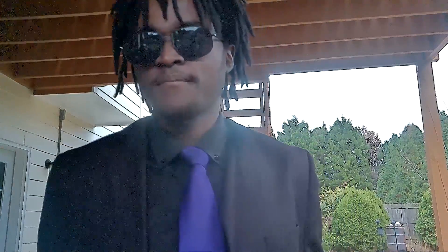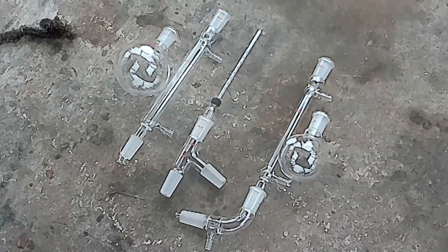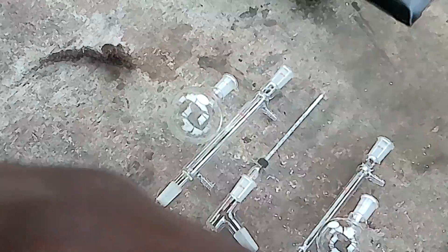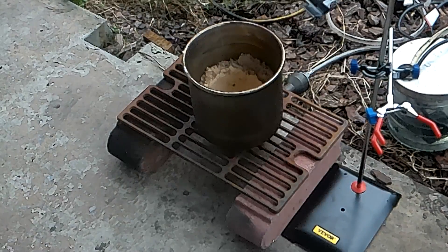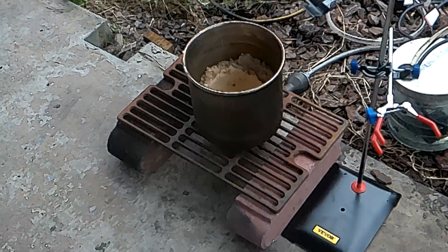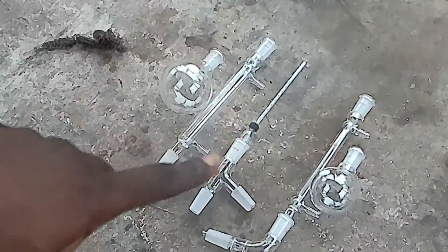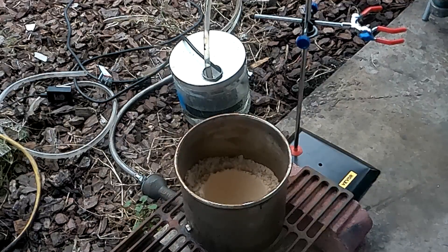I'm not gonna do this like I did before — I'm the Mad Max Nile Red, we know that — but today I'm gonna go Nile Red on them. As you can see, we have the real deal chemistry distillation set glassware so we can see everything as it's happening. We can't heat this directly with a flame; we're gonna heat it indirectly through a sand pan. This is gonna be a fractional distillation setup with two columns — two Liebigs — but we're only gonna use one with actual water in it. The other one is gonna be more like a packing column packed with this metal mesh to increase the surface area.